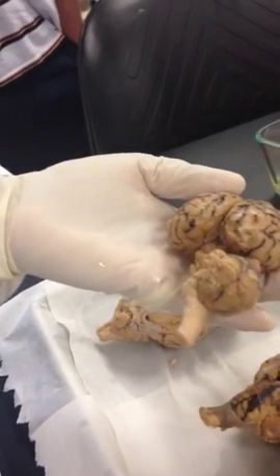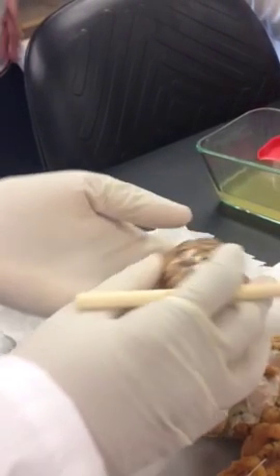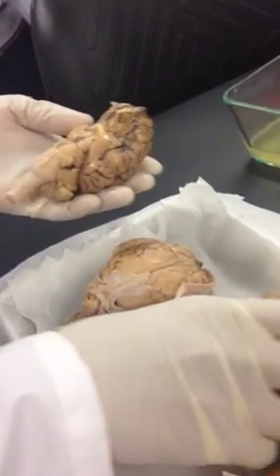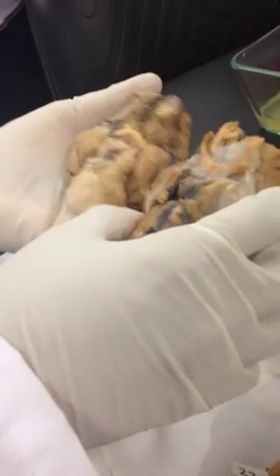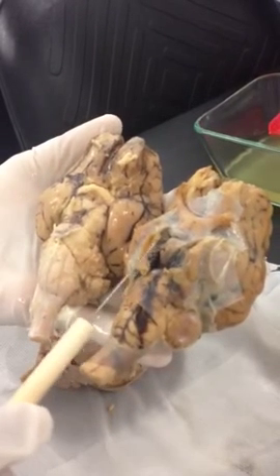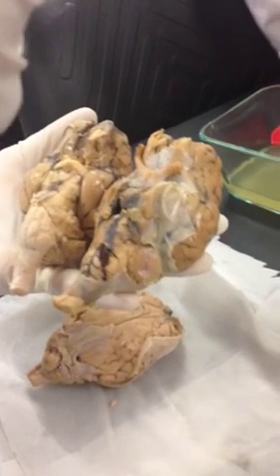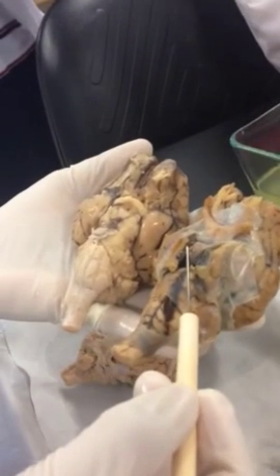Okay, then if you turn over the page, you can see the inferior view of the brain. Okay, so now you can see the inferior view of the brain, and look between these two. Something is missing here, right? You see this bump here? This is your pituitary gland. It's attached to the inferior side of the brain by a little tiny stalk. It looks like a straw, very small, and they call that gland pituitary gland.